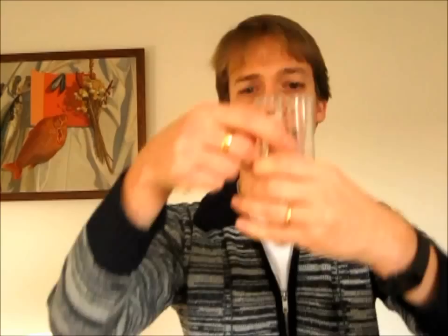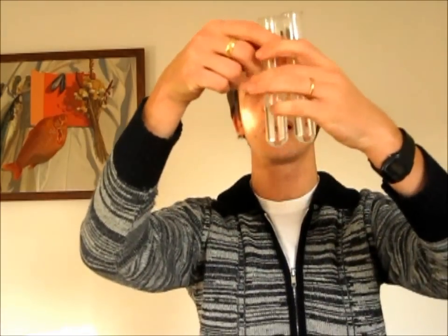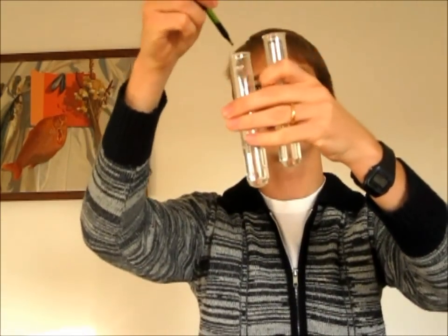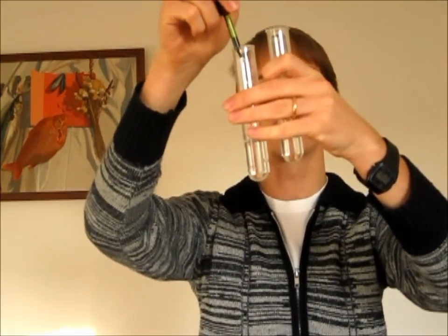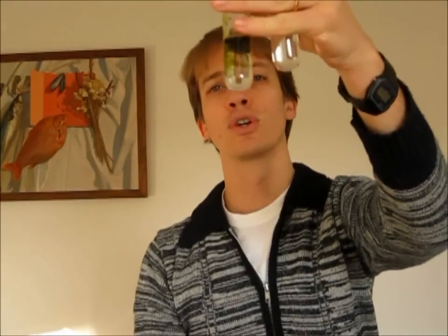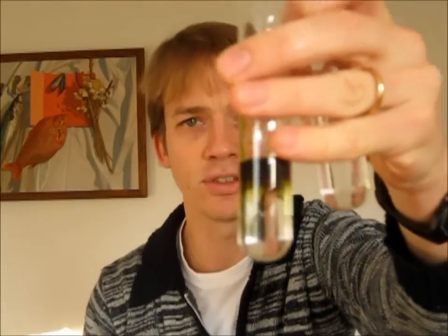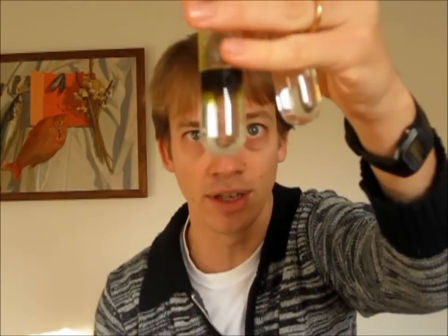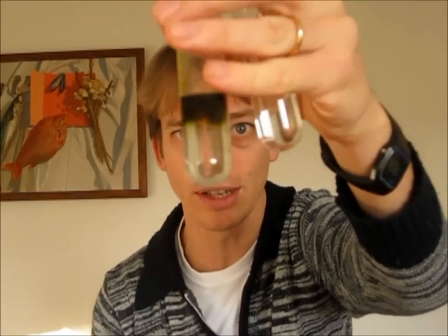Okay, so there we go. That one there is water. Let's see what colour it goes — it goes green. You can see the green. That there is pH 7. It's water.